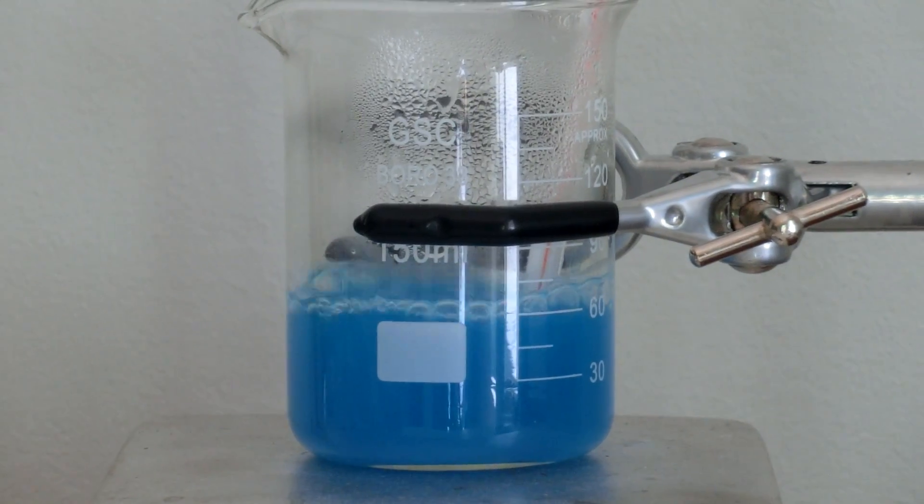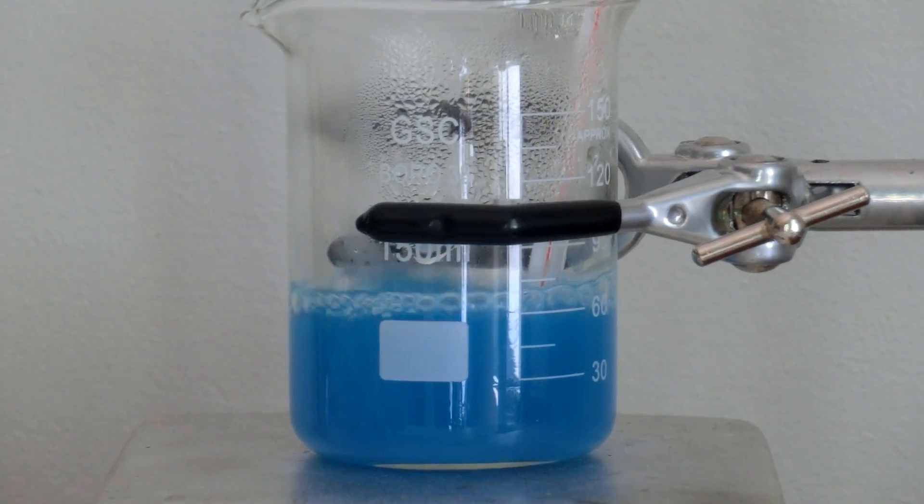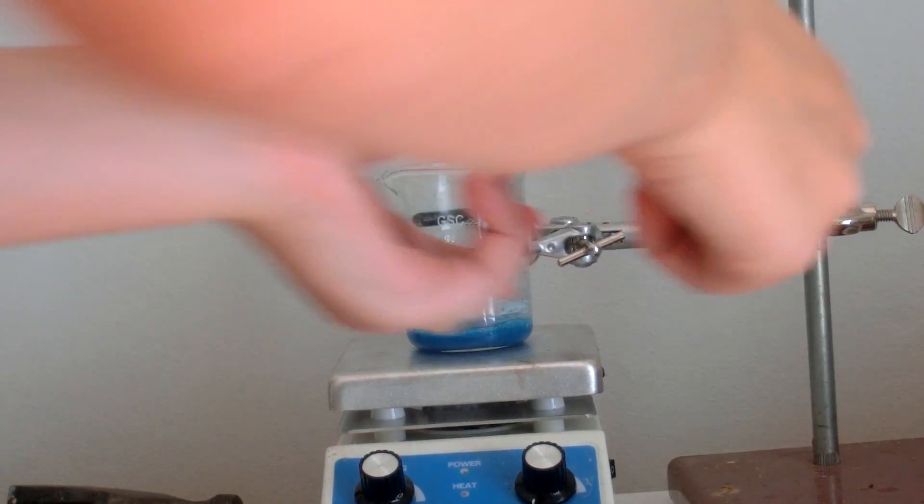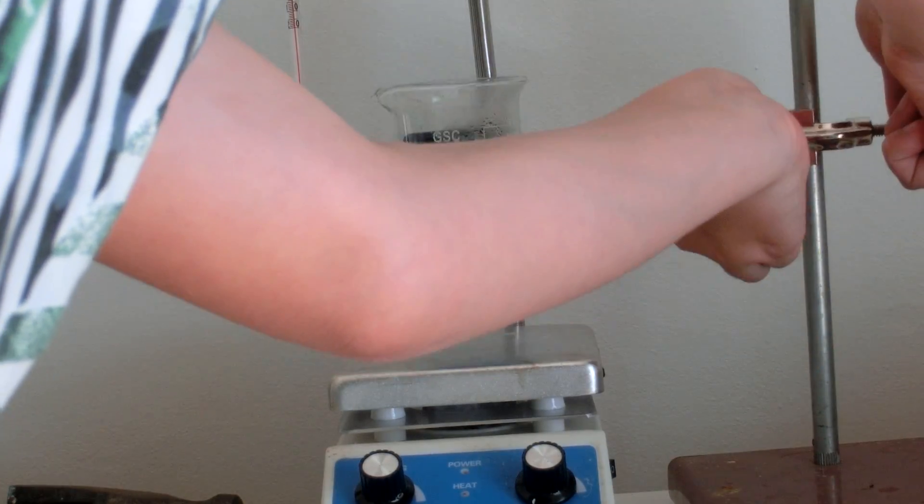Here is the solution boiling. Once crystals start to form, take the beaker off of the hotplate.